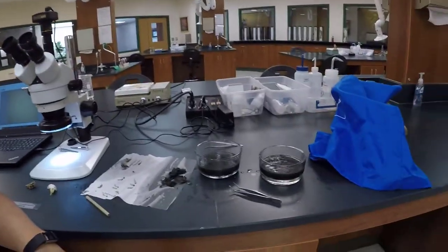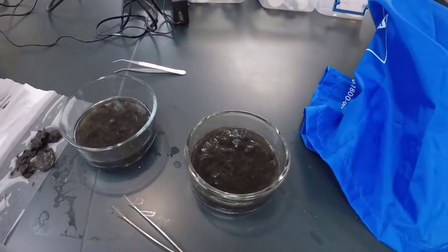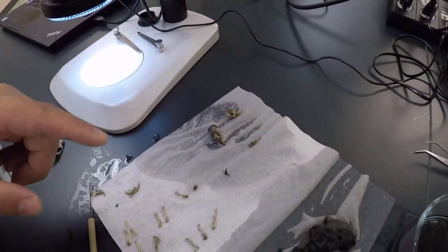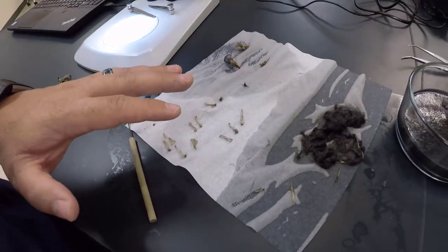I'm back and now I'm going to start walking you through the owl ecology lab — the use of an owl pellet to determine what small mammals and birds barn owls were eating in a given region. I placed the owl pellet in water, and it made a giant mess with a lot of hair. I picked out some bones and skulls to examine. I'm going to walk you through identifying two species and also identifying the bones that are important for this lab.